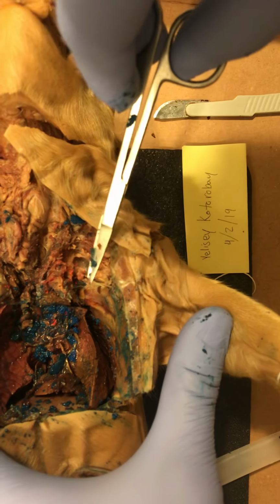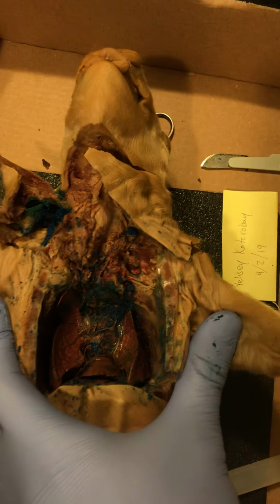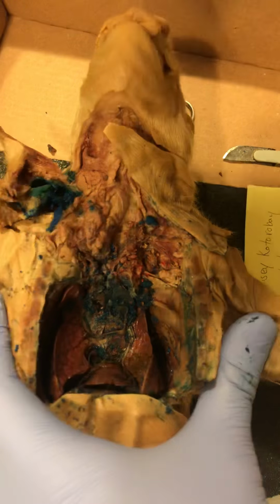I think I better take two pictures, right? What is this? Oh, to clean that stuff. Thanks. Should I wipe up the blue stuff? Alright, I'm going to clean up some of the dye that was left over from the heart. So we have that there. I'll leave that off to the side. Honestly, I think this is the best I can do because it seems to be inside where I had to cut to get in.